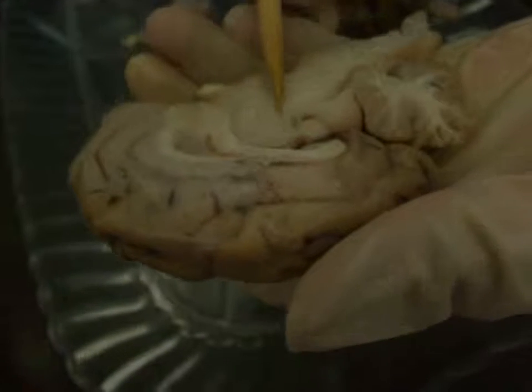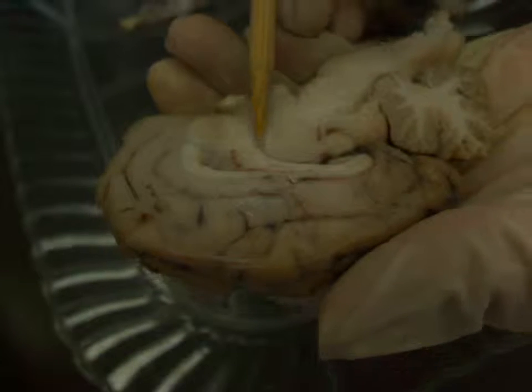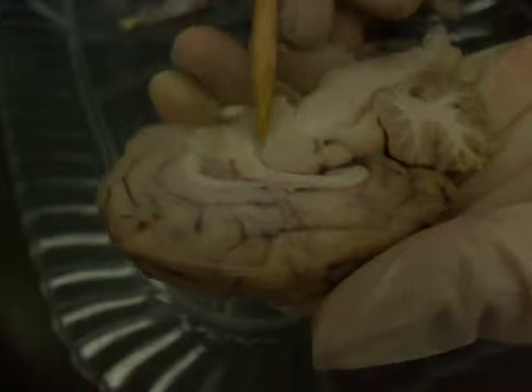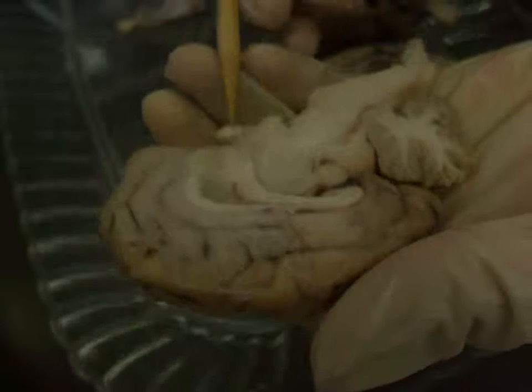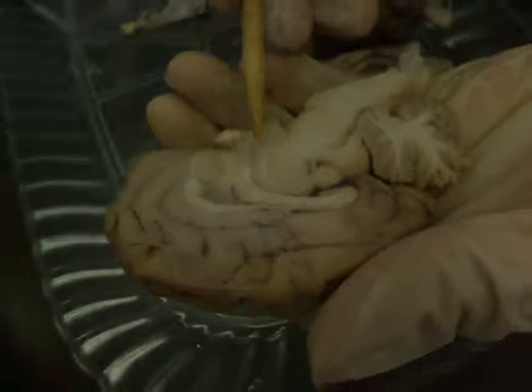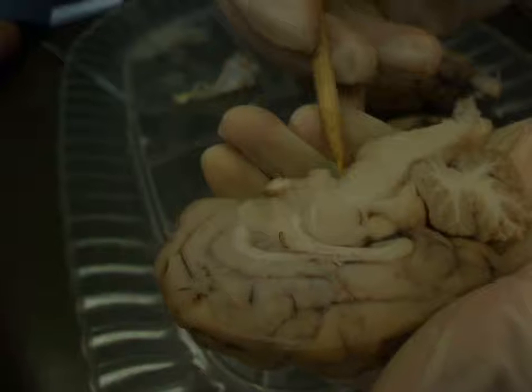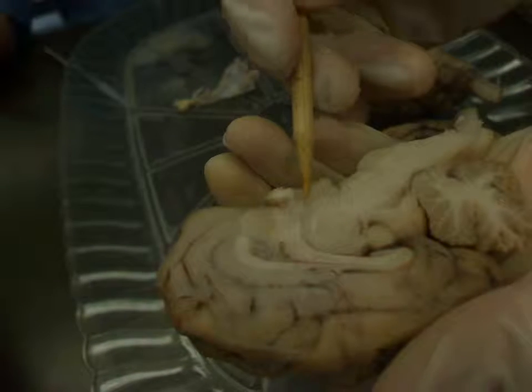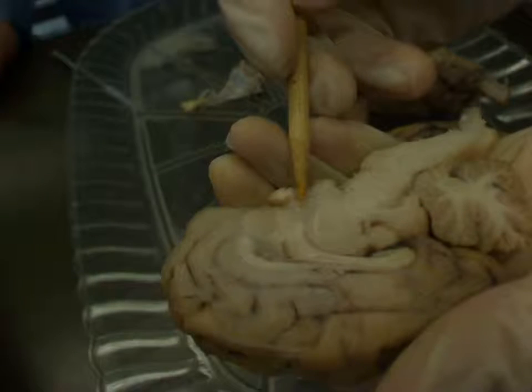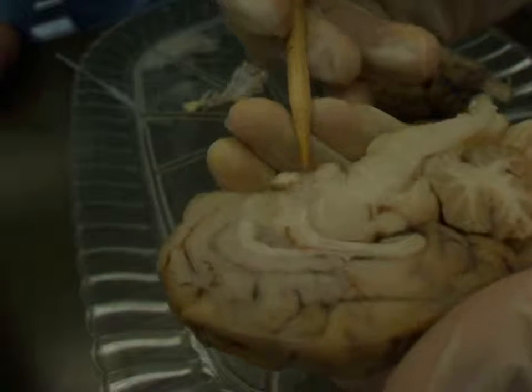So then in diencephalon, we have the thalamus, this whole circle right here. Wrapping around the thalamus would be the third ventricle. We have the hypothalamus, which is defined by what it's not. So it's below the thalamus, which is a circle up here. It's not the chiasm, and it's not the cerebral peduncle. Okay, so we can draw a square delineating that it's not any of those things. So it's not chiasm, it's not thalamus, it's not cerebral peduncle. Okay.